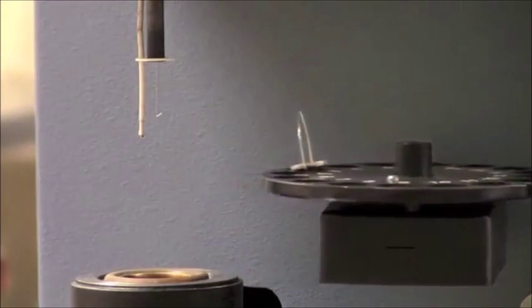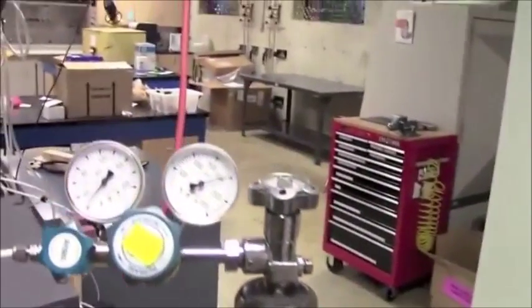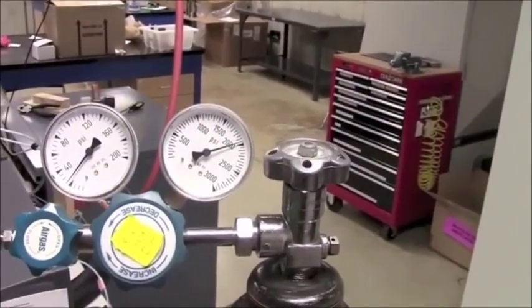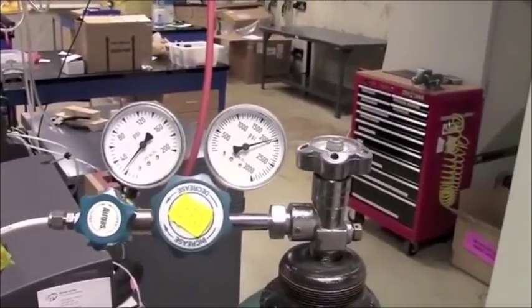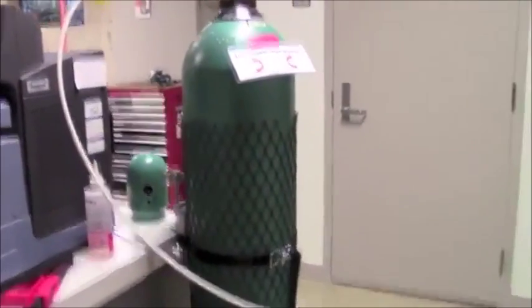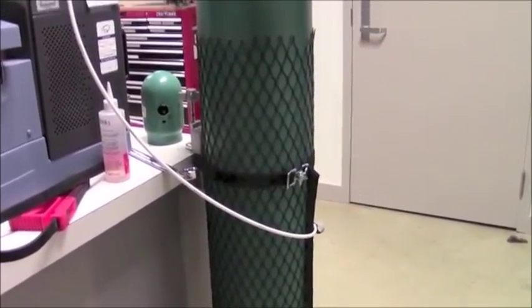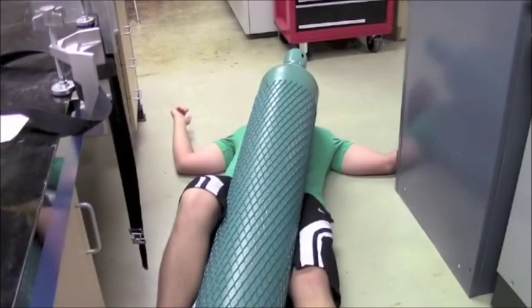So what we want to do first is go to the nitrogen tank. On the far right is the main nozzle, that shouldn't be adjusted. On the far left is the nozzle that will adjust whether or not the nitrogen is on. This is how the nitrogen tank is secured. When handling the nitrogen tank, you should not be removing the nitrogen tank, or serious injury or death may occur.